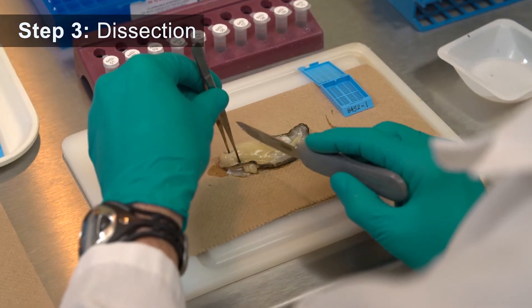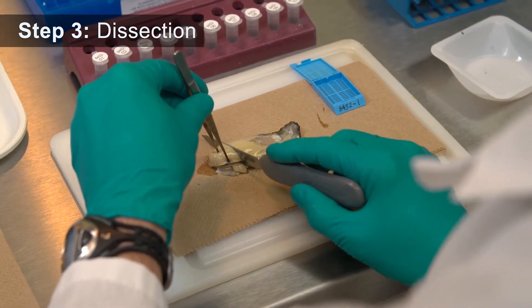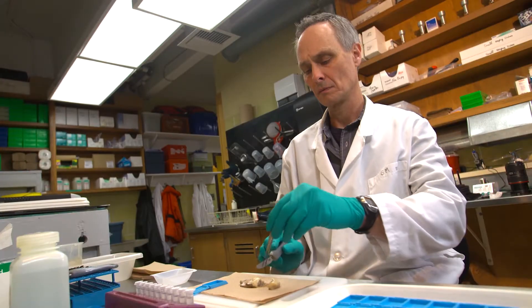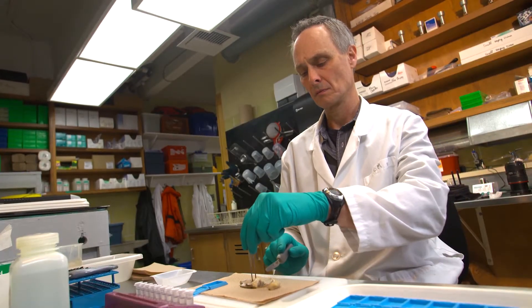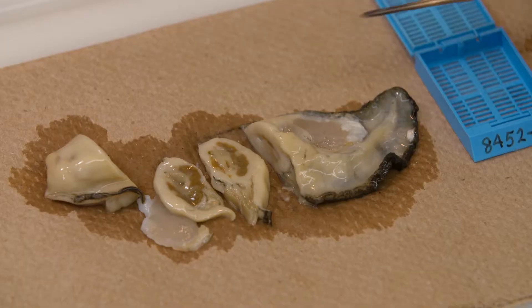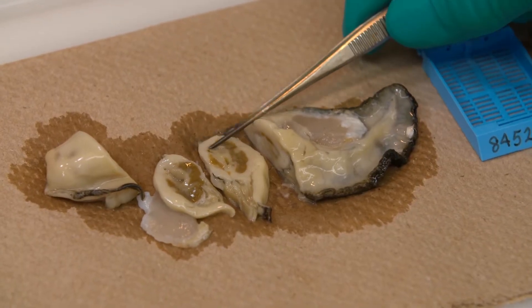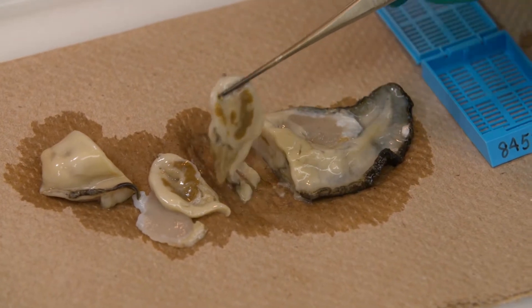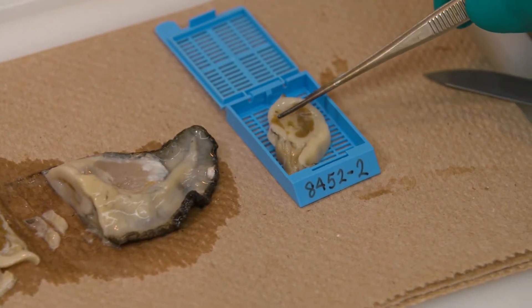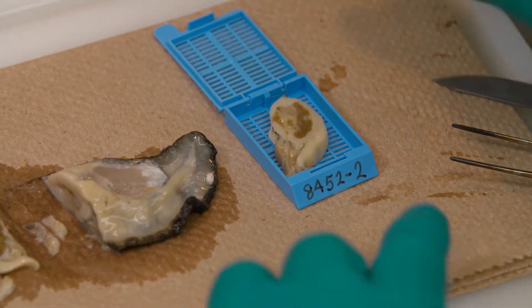The dissection process begins by sectioning the oyster into small segments across the oyster's digestive gland and gills. Then, these tissue sections are placed in cassettes to be preserved for further processing at the histology laboratory.